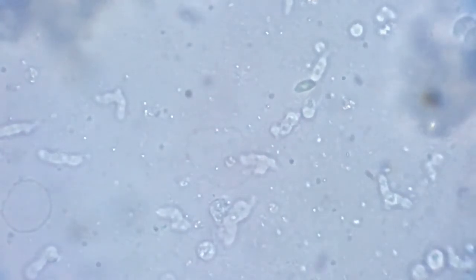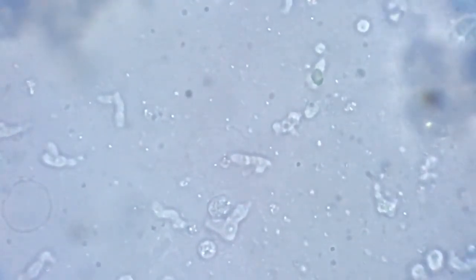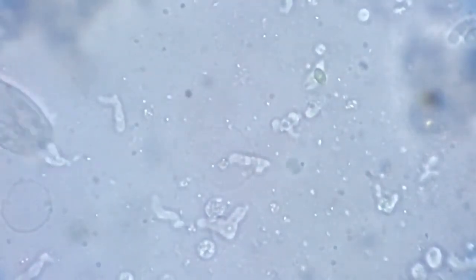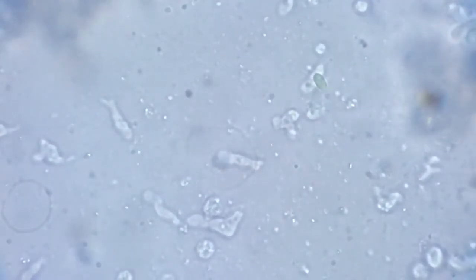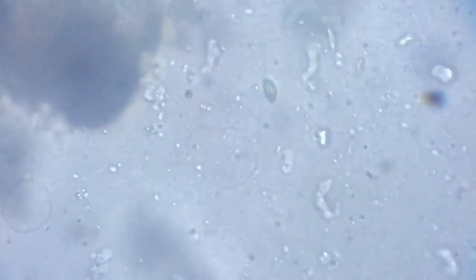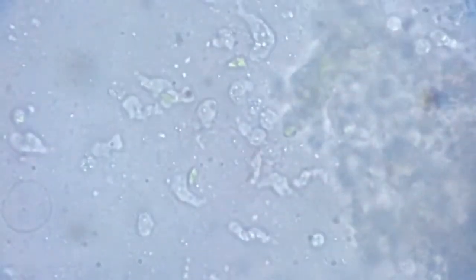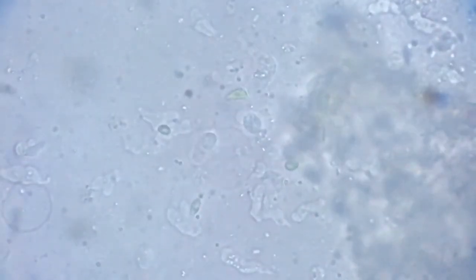I'm wondering where I should transfer this solution of the microscope slide, because I can't afford to lose these microbes. I can't afford to lose these amoeba. They have to move to some rich area, something which will keep them surviving, which would give them good food and nourish them.